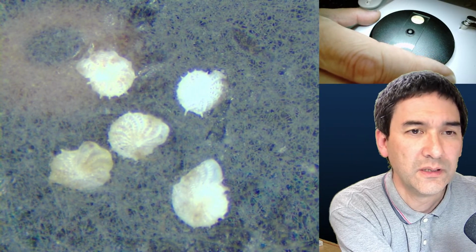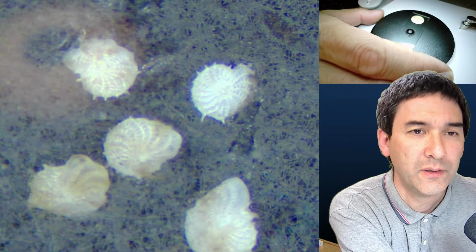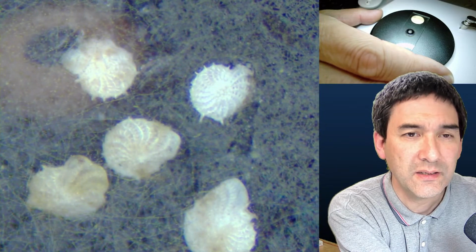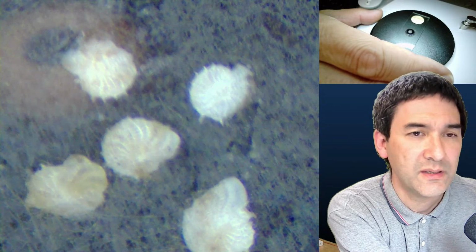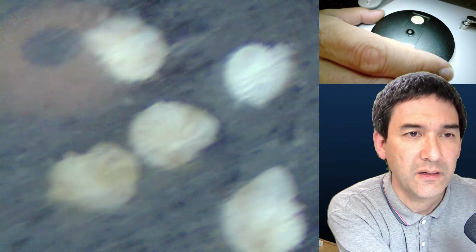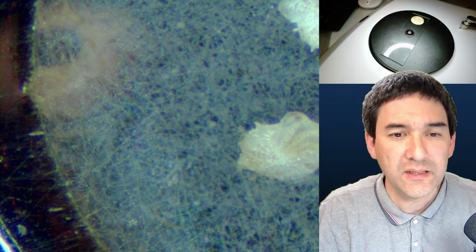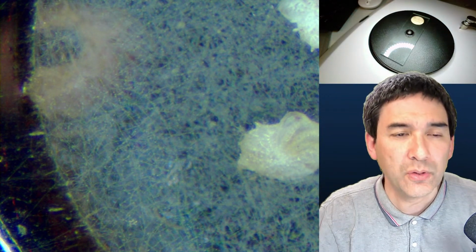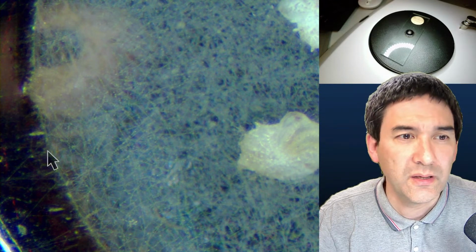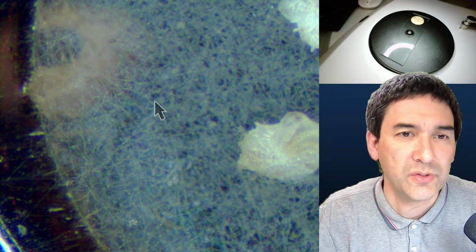Look, it looks like tiny foraminifera, which have been placed on the slide. And something that I wonder what it is a little bit, those lines in the background. I wonder if these are paper fibers or if this is some kind of a fungus. I don't know. Those things here look almost a little bit like a fungus or something, but I don't know.